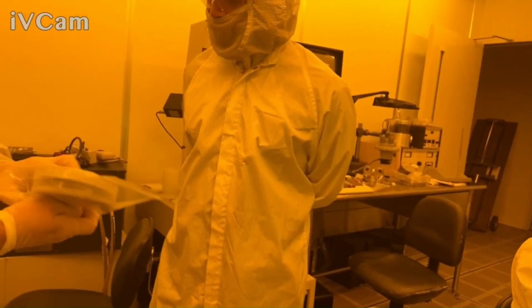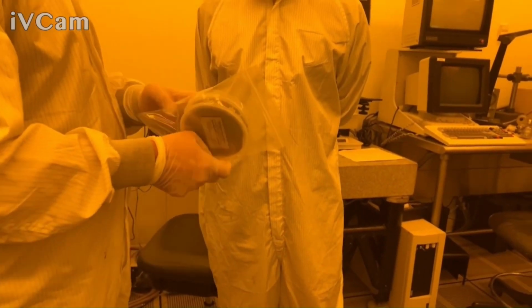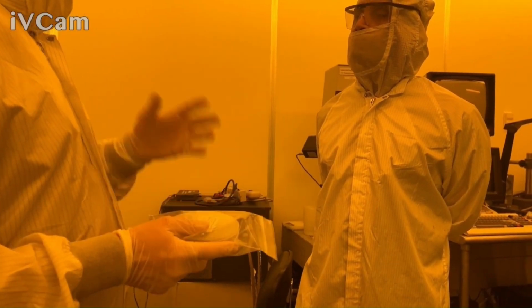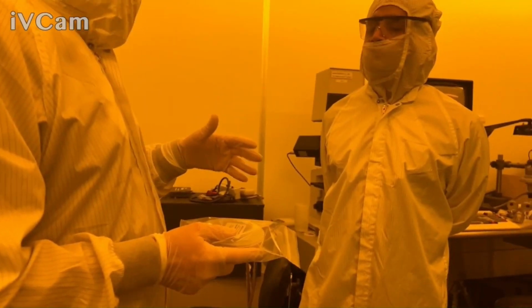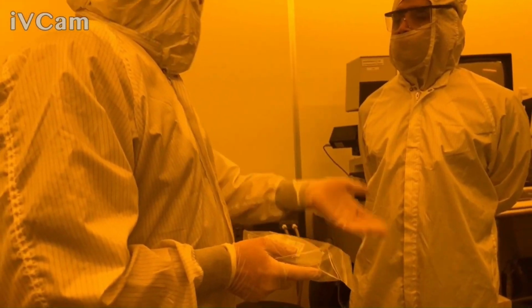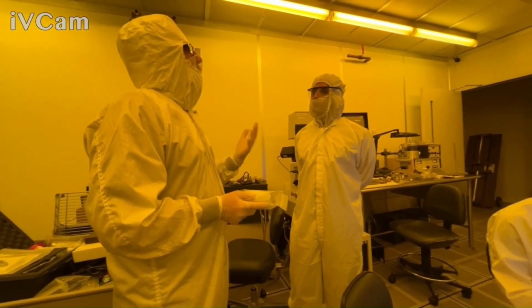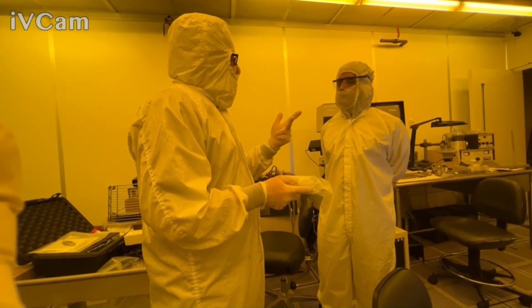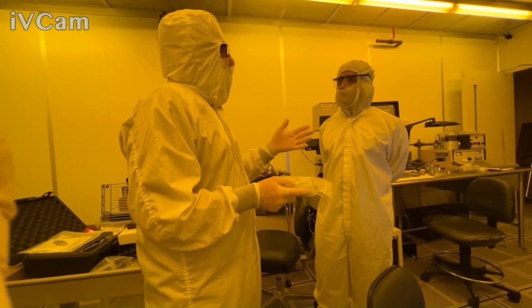I also brought a thicker thermal. So this is about 500 nanometer thermal oxide. Okay. So I was mentioning that if you guys are doing thin metals, because it sounds like you might at some point. So optically thin, I can see through 20 nanometers of silver or platinum or whatever. The hard part is if it's thin enough and you have unknowns of n, k, and thickness at all wavelengths, basically absorption everywhere, you're kind of underdetermined.